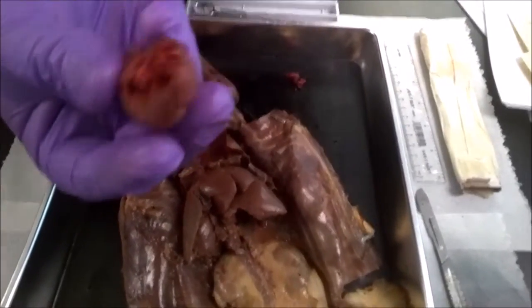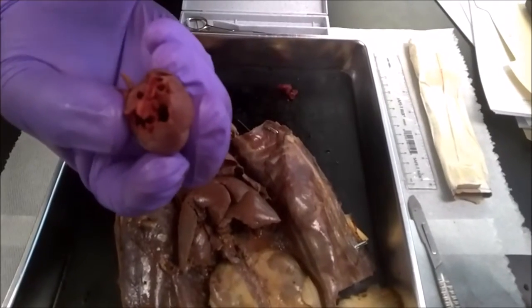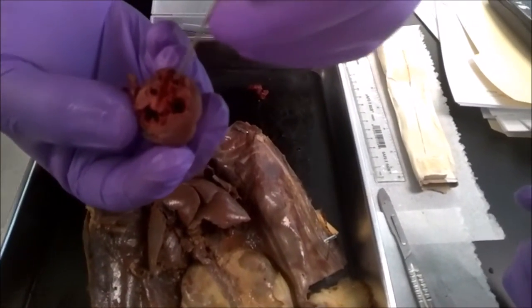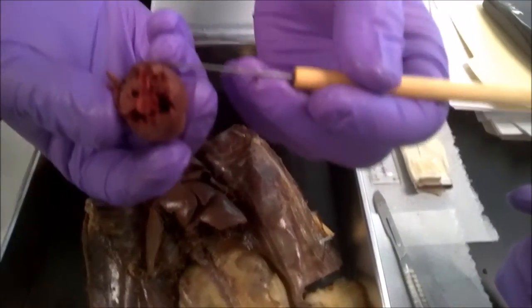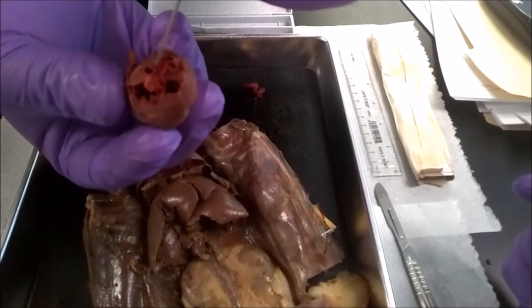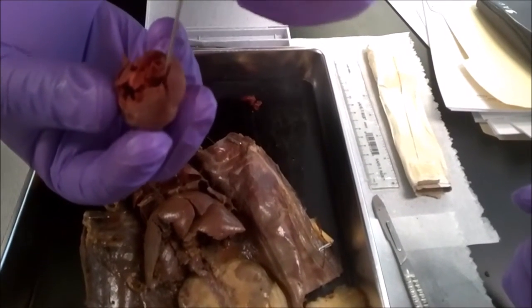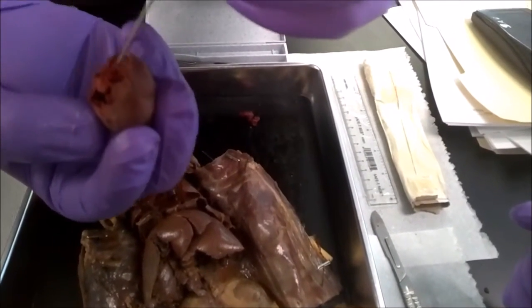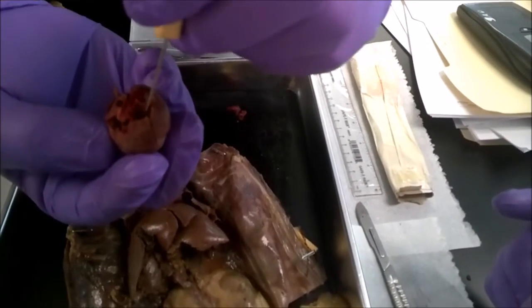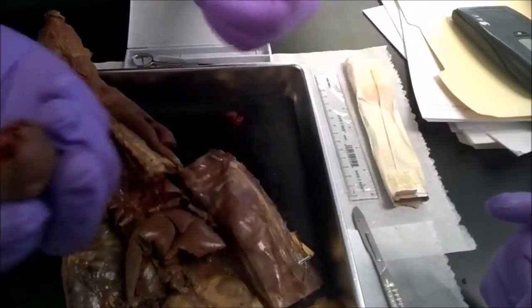When we close it back up, we're looking at the top of the heart. Right here is your superior vena cava. This is your vein that is filling up your right side, your right atrium — that's unoxygenated blood. And then it's coming out up here through your aorta, which is from your left ventricle. It's not as big as this, but that's now all your oxygenated blood getting out, going out through the whole body.